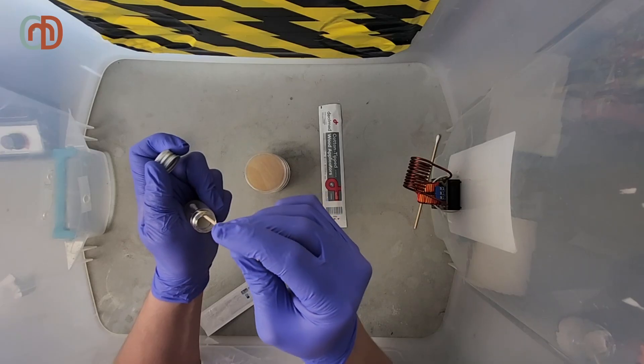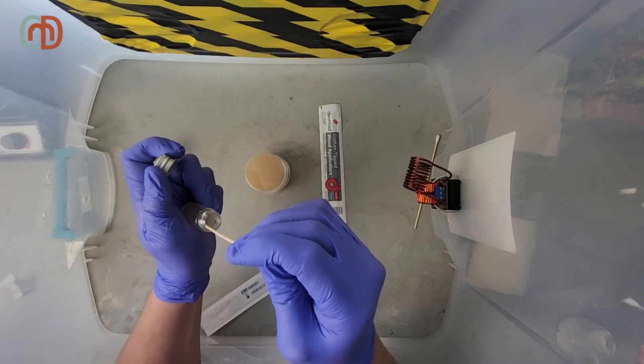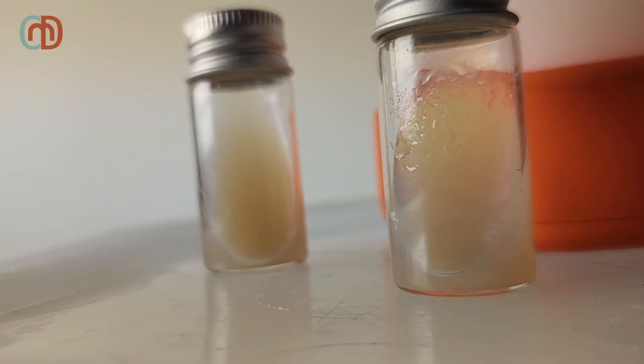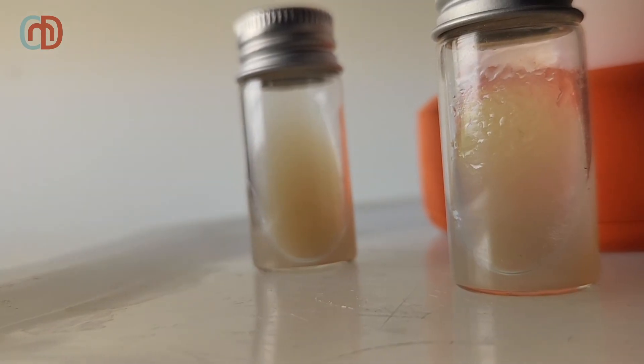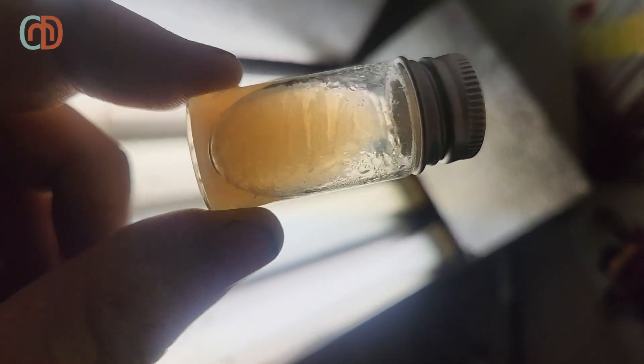I repeat this entire process one more time to create two slants. I like to have backups of all of my genetics in storage, in case a problem occurs. I store these in the fridge inside of a plastic bag, and I've used cultures that are over 5 years old with no problem. I let them sit at room temperature for around 2 days to grow out. Then I'll just store them in the fridge for when I'm ready to use them.